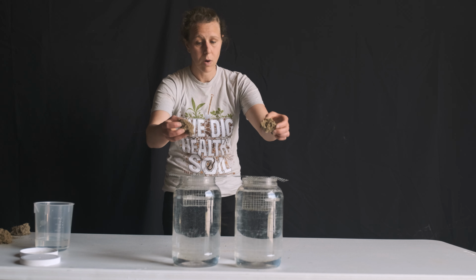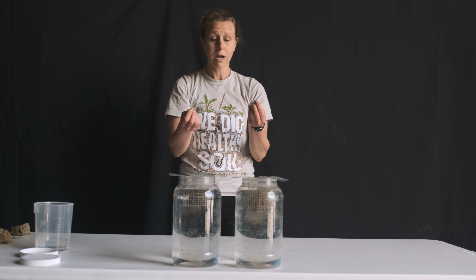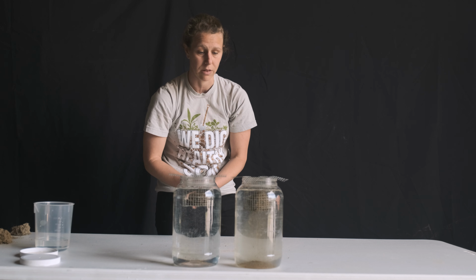And you're going to see what happens as I drop these into water. And so these started out as air-dried aggregates. And so with aggregate stability, you can see the structure of the soil on the right is breaking apart, or slaking, hence slake test. Whereas on the left, this healthy soil with roots, good soil structure, and pore space, the water is able to penetrate into the soil and there's very little to no slaking of the particles apart from each other.